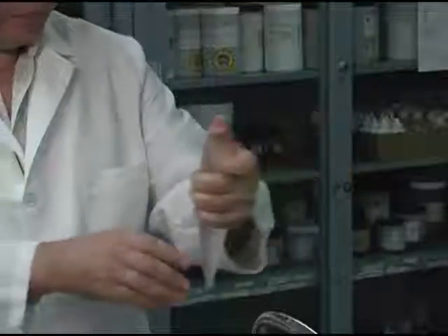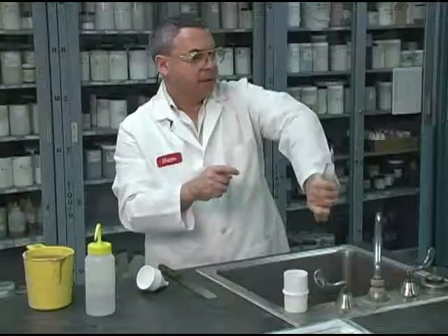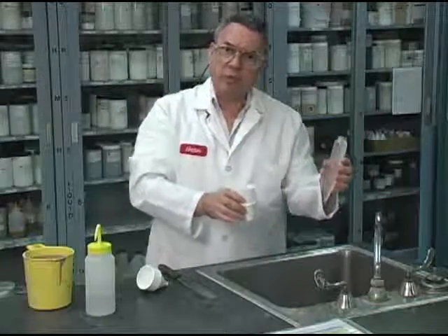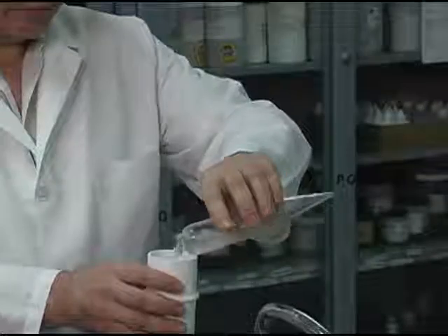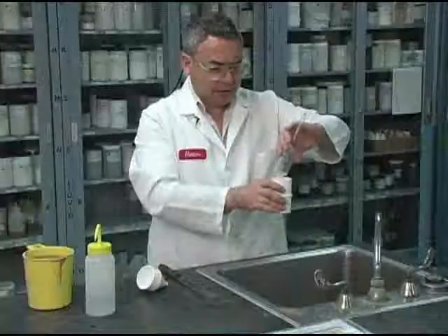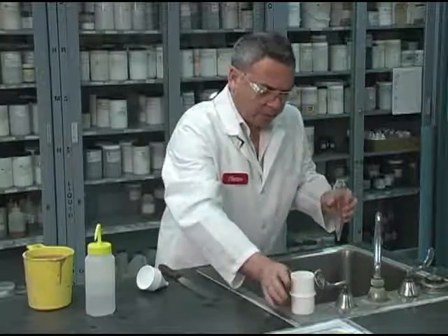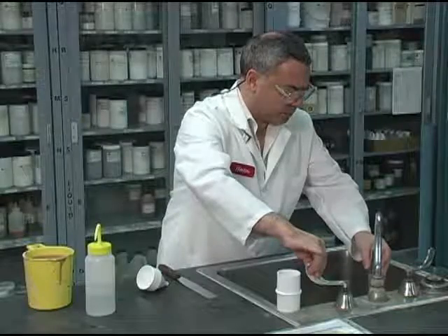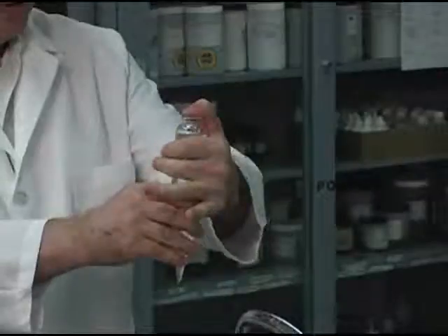Every individual shake, a few, maybe 45 seconds. Make sure that everything deposited here gets removed. So I need to make sure that all the sand that is here goes through into the screen. I want to do it one more time, practically coming to an end. I can see that this is very clean.